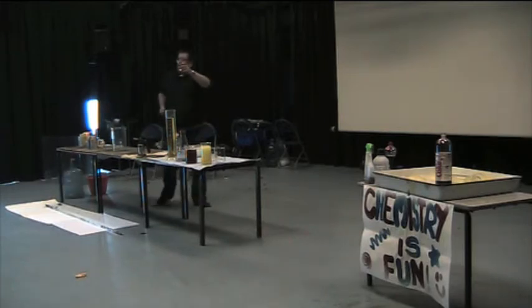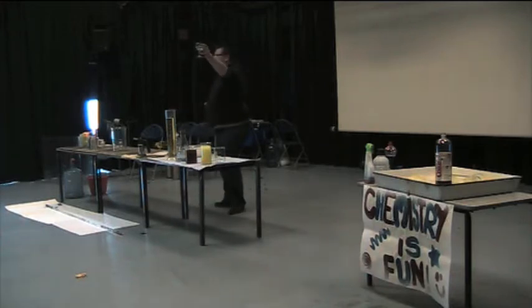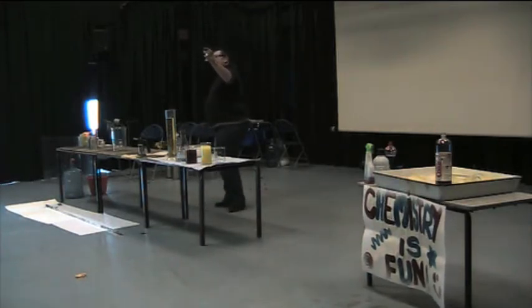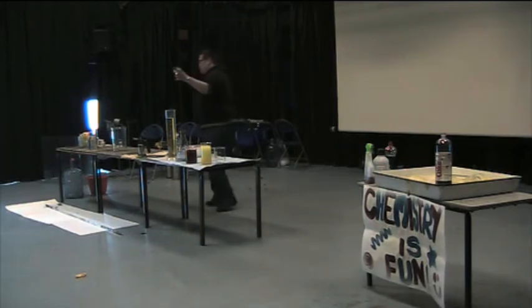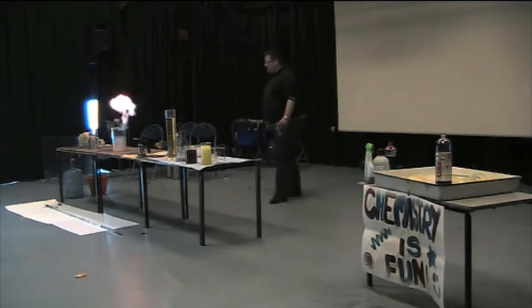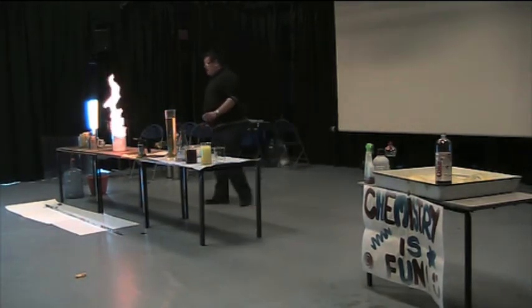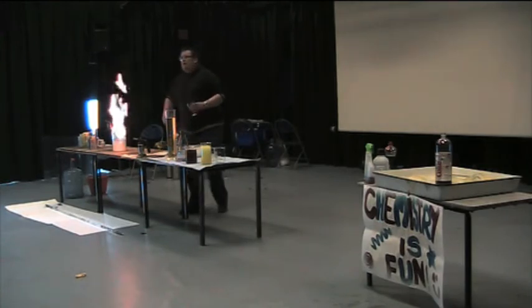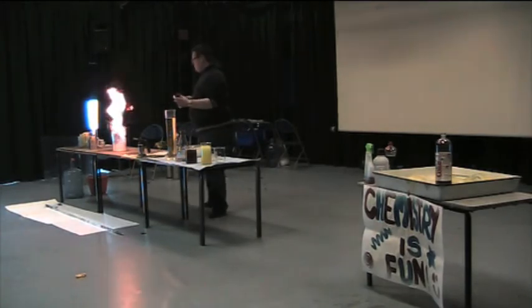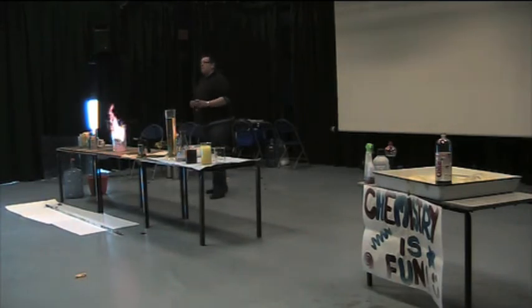Here's a glass of water, and I'm just going to have a sip of it to prove it. Okay, that's just normal tap water. And what I'm going to do is pour this water into the beaker. Okay, watch carefully. Now that's not really what you would expect to happen when you pour water on something. Can you see a colour in the flame apart from the orange? A sort of bluey lilac, yeah?